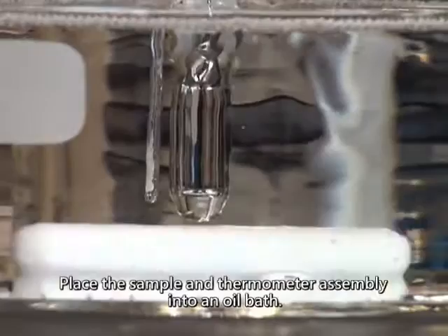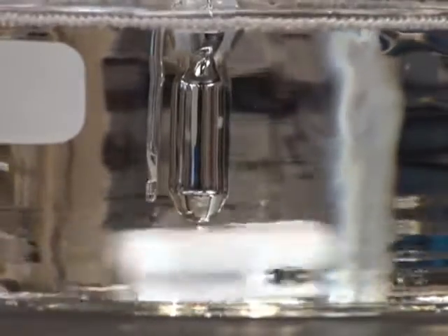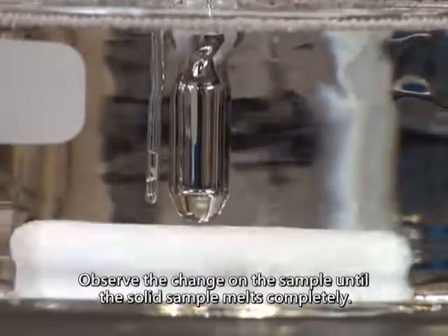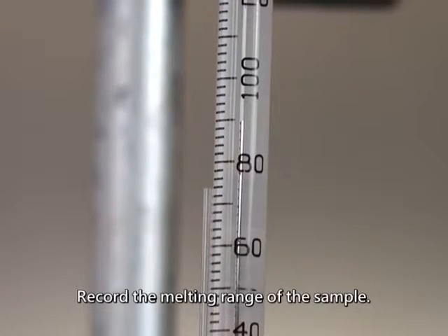Place the sample and the thermometer assembly into an oil bath. Heat the oil bath gently. Observe the change on the sample until the solid sample melts completely. Record the melting range of the sample.